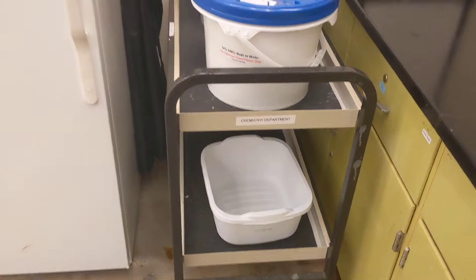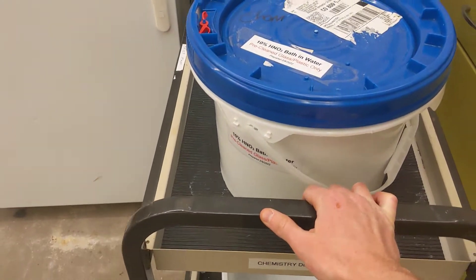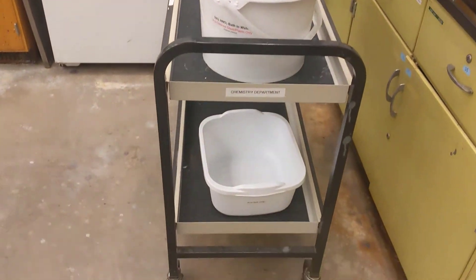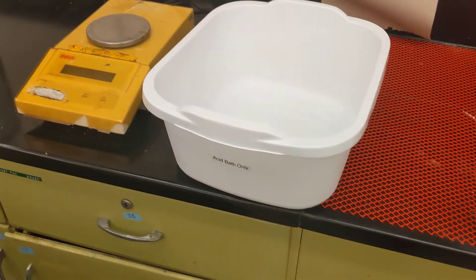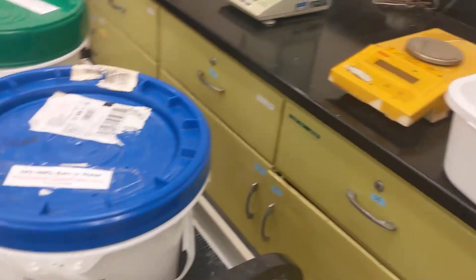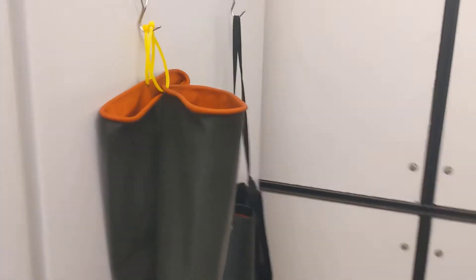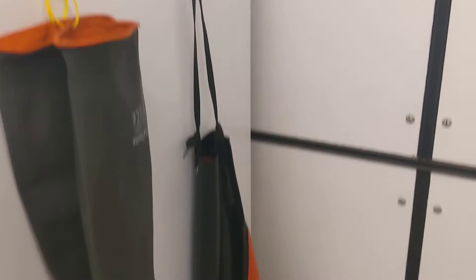When you're ready to use the bath, carefully slide the cart out, then reach down and grab one of the plastic totes that says 'acid bath only' — this is going to be your rinse tote. The other thing you'll want to grab is the pair of rubber gauntlets hanging from zip ties, and then the chemical-proof apron.